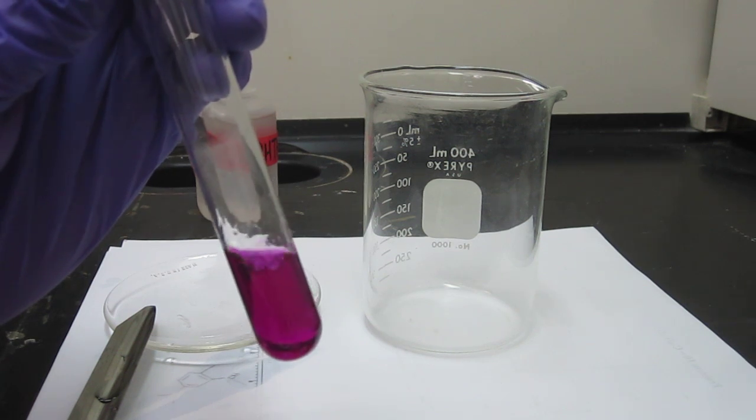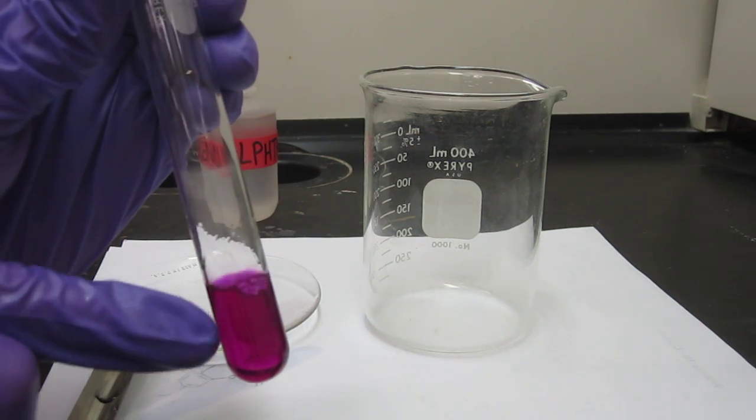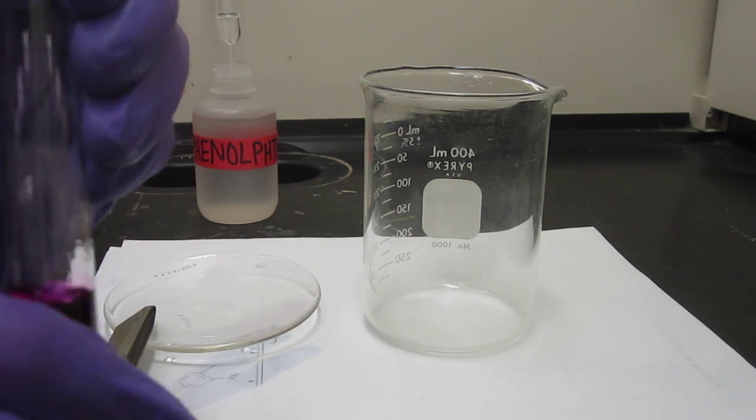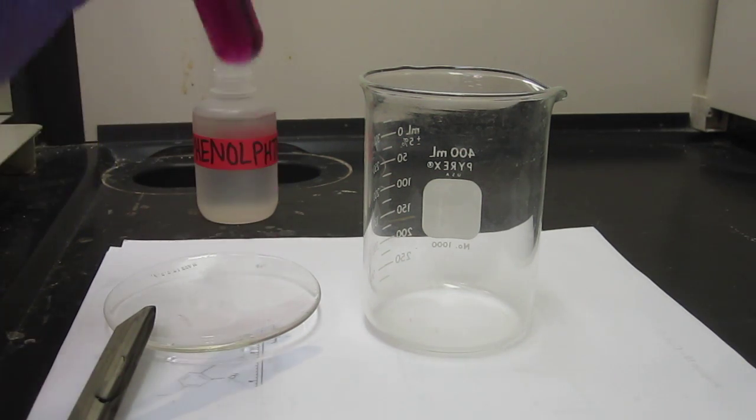And what is the salt that we're forming in there? Remember last time it was what? Sodium hydroxide, right? What do you think this is? There's ethanol in there. Sodium ethoxide. Sodium ethoxide, yeah.